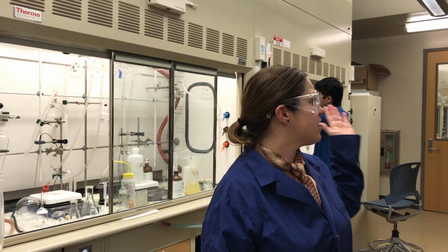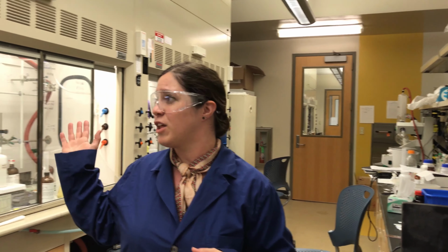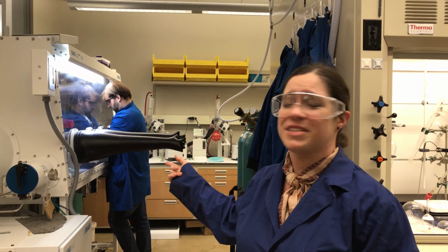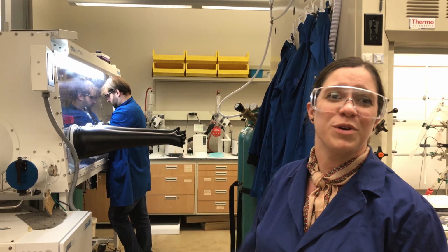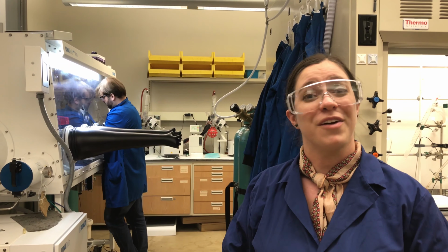Now we are inside one of the organic research labs inside the chemistry and materials building. This is some of the newer labs that we have. Again, this building was done in 2012. There are lab bench spaces available, hood bench spaces available, and there are even glove boxes depending on the type of research. Now this is Dr. Semin Lee's lab, so this is his postdoc working in the glove box, but this is an example of one of the labs that we have for you to do research in.